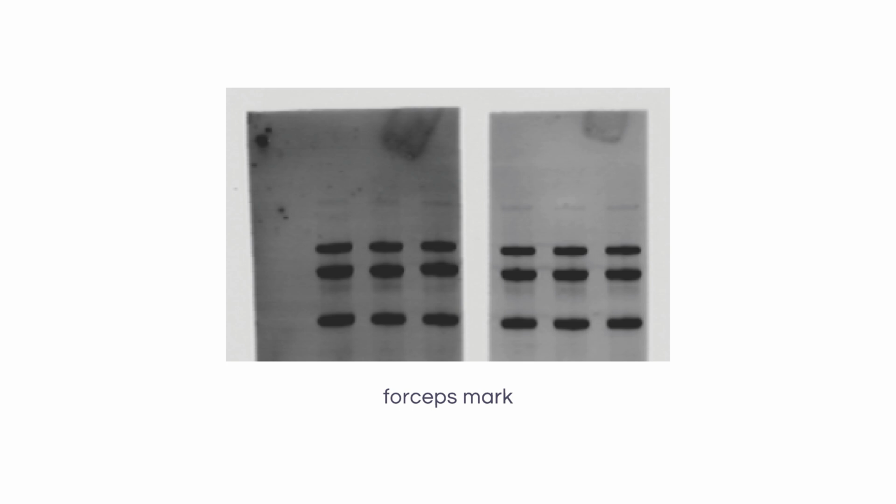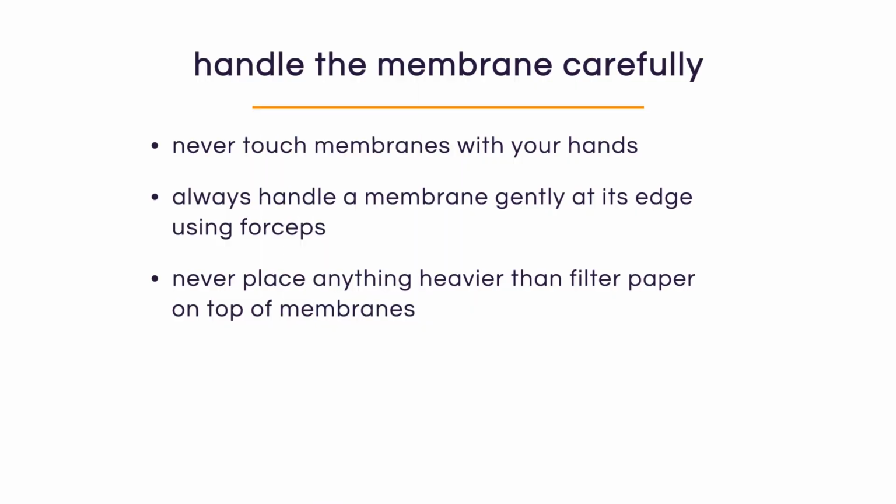membrane, creating background. The same thing can happen if we use too much pressure to write on the membrane. Even with a pencil, we can easily see the imprint of what we wrote on the membrane, having that unwanted background. Therefore, we never want to place anything heavier than filter paper on our membrane so that we don't have that unwanted background. And if you end up touching your membrane, we will know because we're going to see that FBI quality fingerprint.